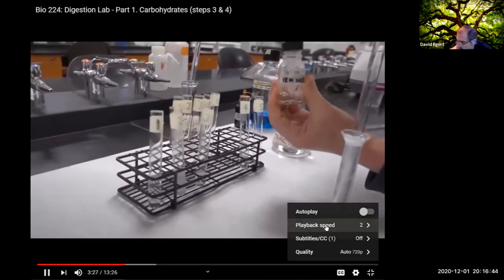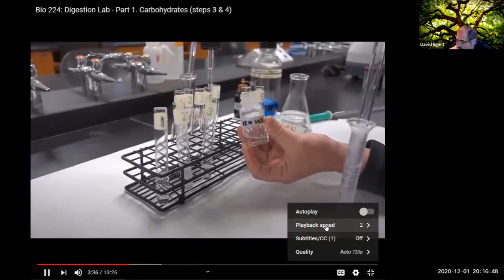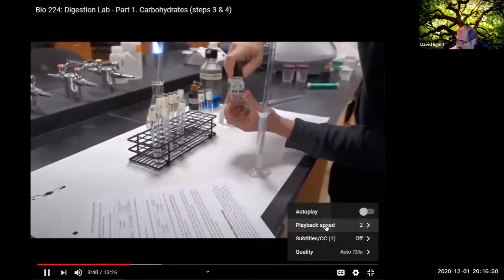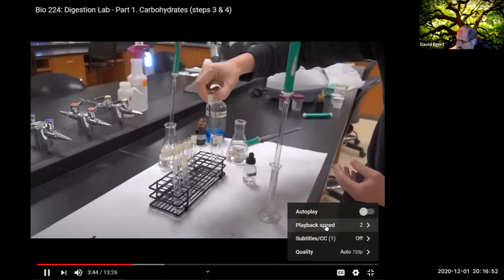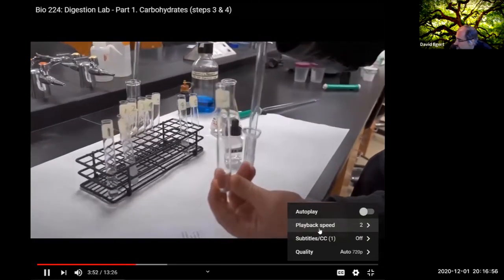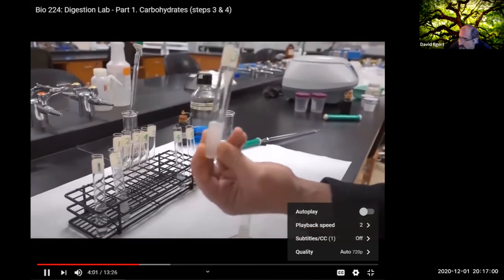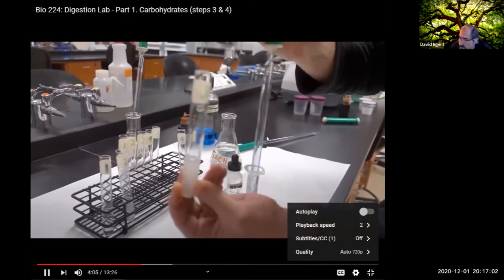We're going to add 5 drops of the concentrated hydrochloric acid here. 1, 2, 3, 4, 5. So now we have this very low pH solution, and now we're going to add 3 mils of our saliva into this. So 3 mils of saliva, but the conditions here are going to be very acidic for this salivary amylase.